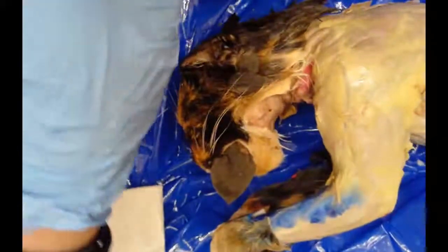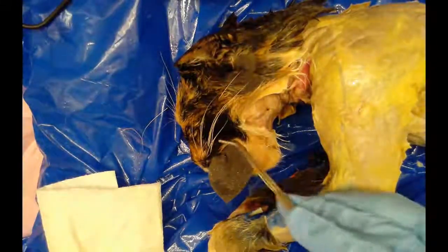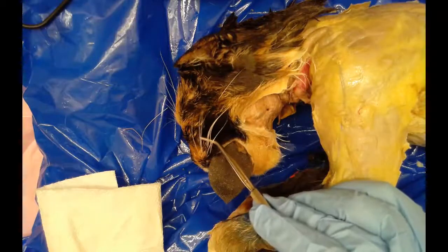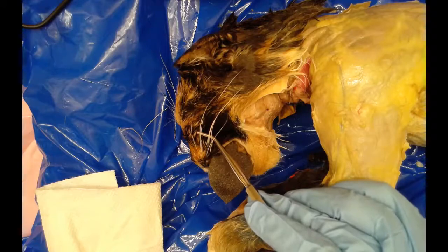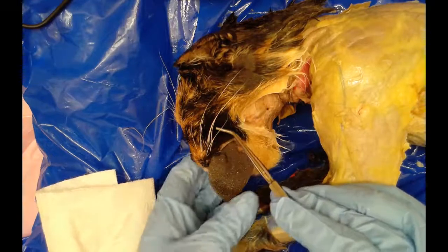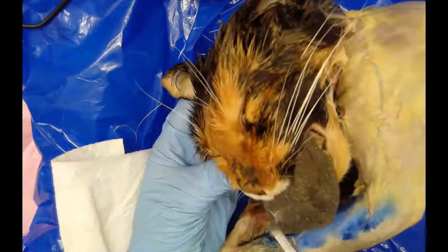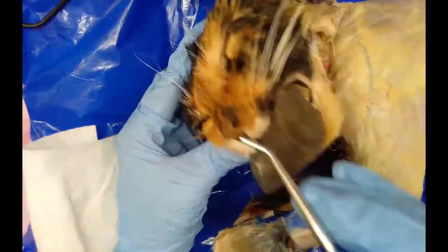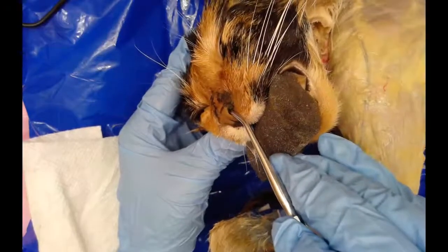We're going to focus on the head region for a moment. Cats have these little whiskers here called vibrissae, V-I-B-R-I-S-S-A-E. And then just in the middle, on either side of those vibrissae, is the nose. These openings here are the external nares, or nostrils.